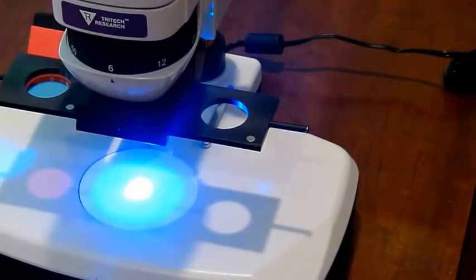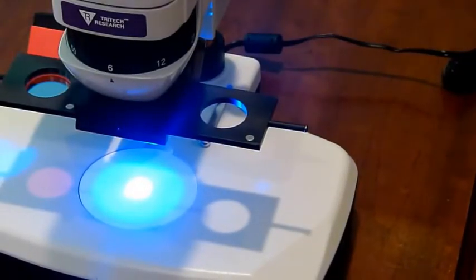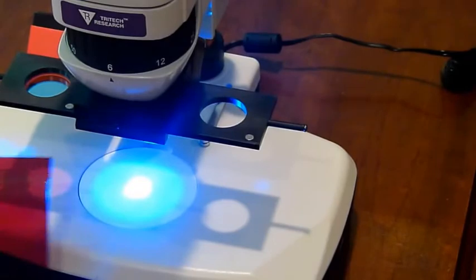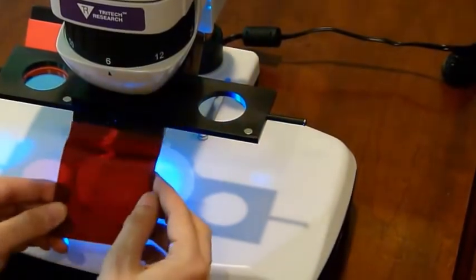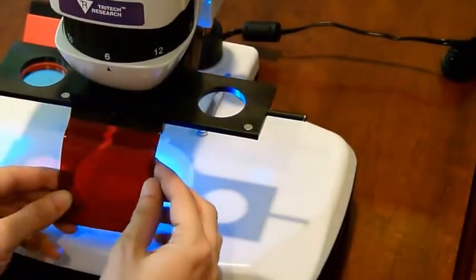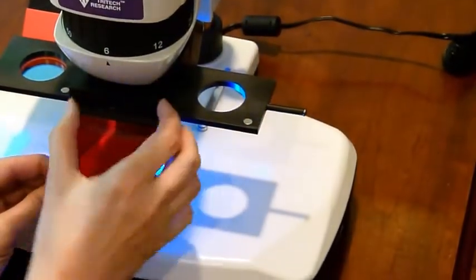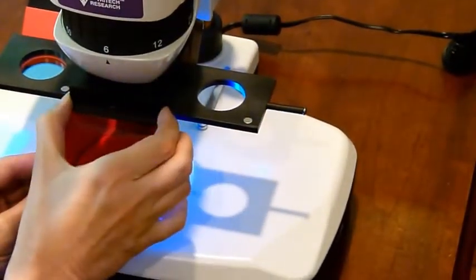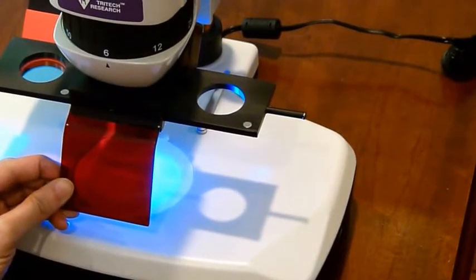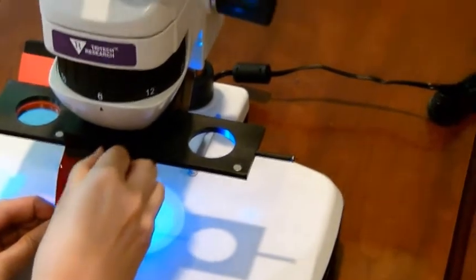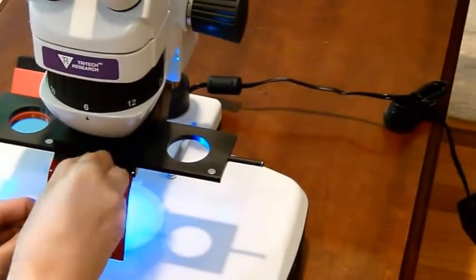And we have a glare shield to block this. So there's a slot right here. You insert it into the slot. Line it up so it's the same width as the bracket, and tighten this little set screw.